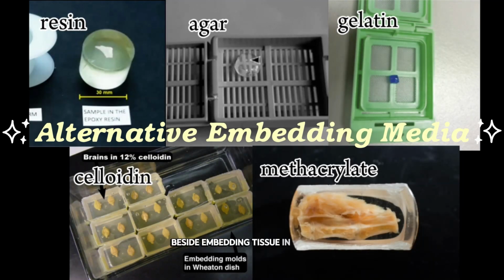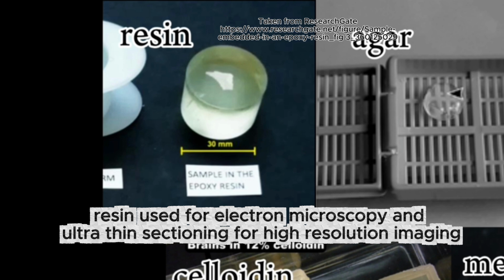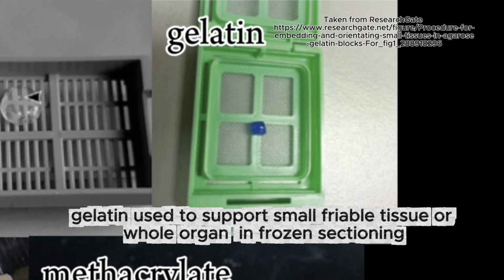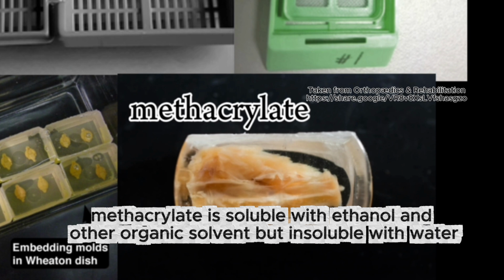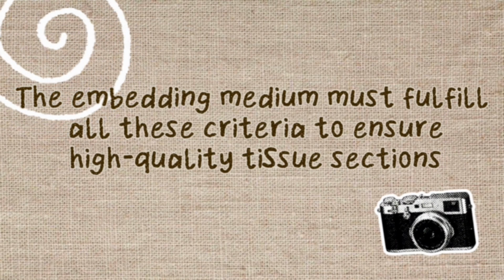Besides embedding tissue in paraffin, there are other alternative embedding media that are sometimes used. The embedding medium must fulfill all these criteria to ensure high-quality tissue sections.